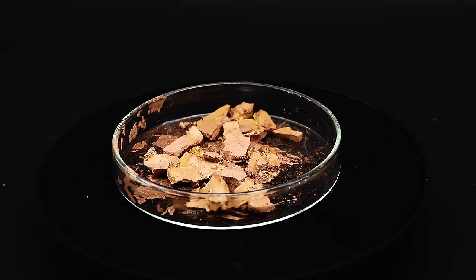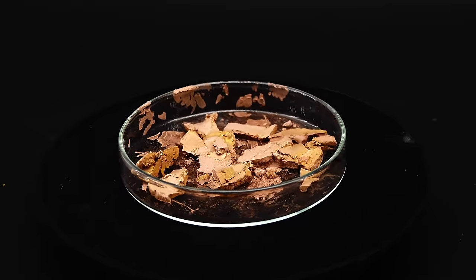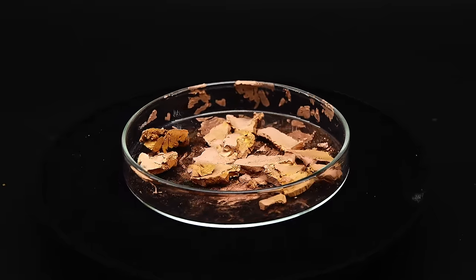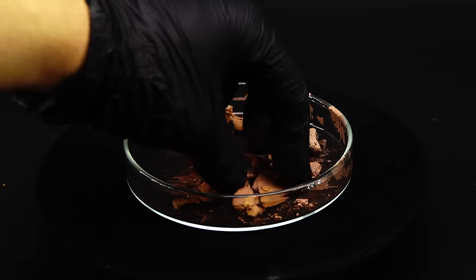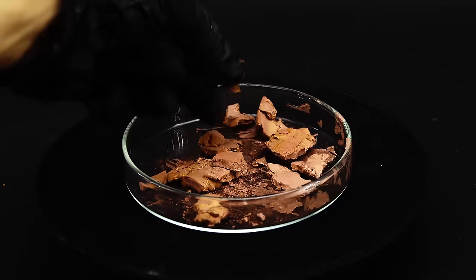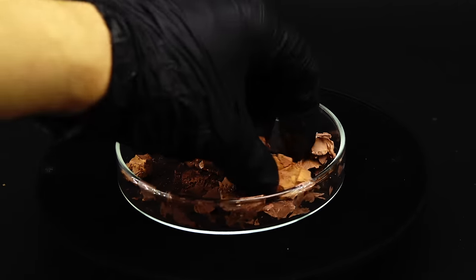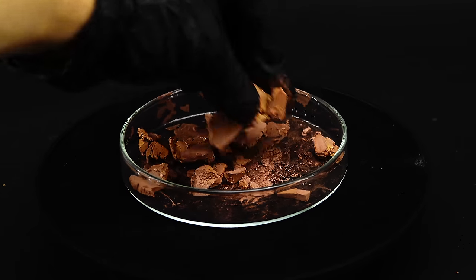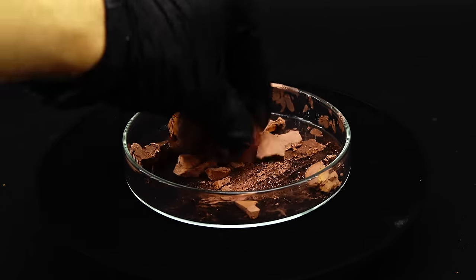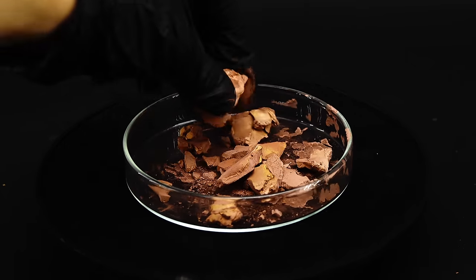It turns out that the powder I made is so insanely fine, it doesn't behave like a powder anymore, and instead of being loose after drying, it decided to become what I call copper clay. This material is really heavy, and has a similar density to bulk copper, however, it looks just like some dry clay, and is also incredibly brittle. Apart from all the confusion, and the product apparently breaking the universal rules of powders, this substance should be more than suitable to make the amalgam with.